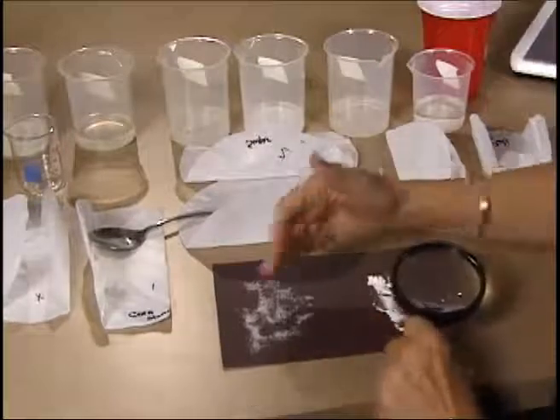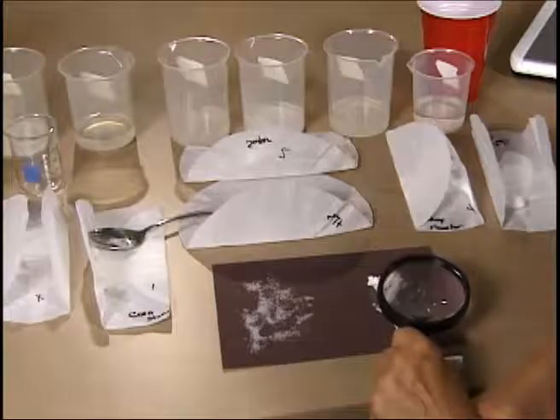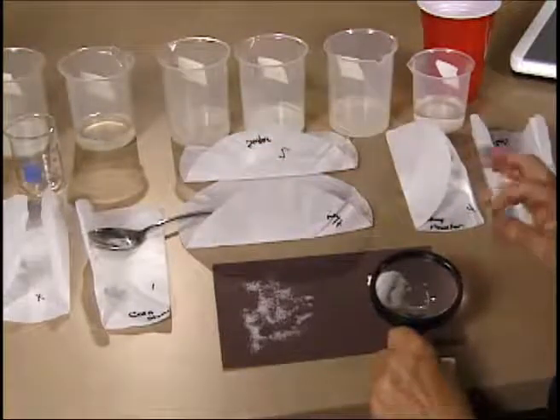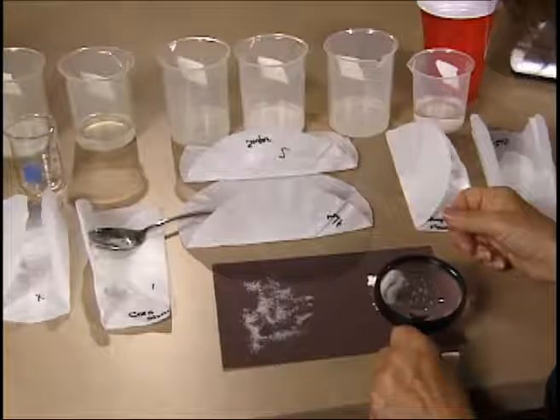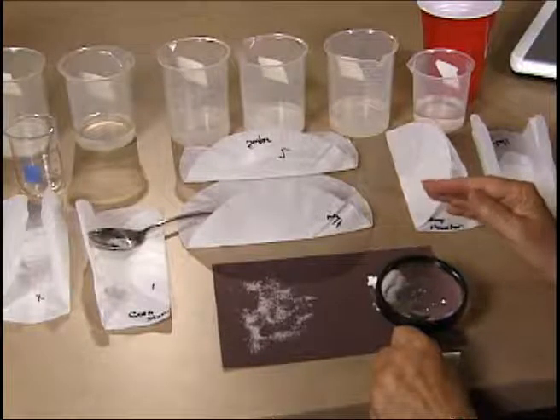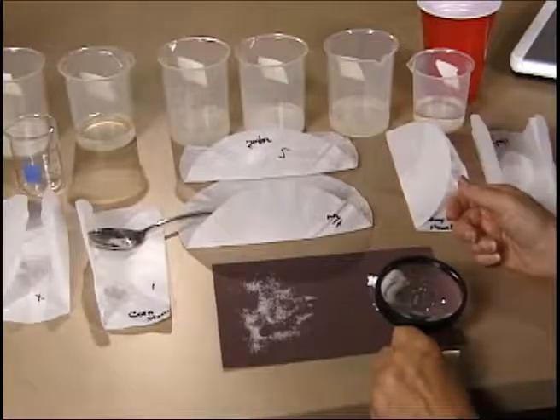And so the difference between these two substances is obviously very clear, and as we go through each of the other substances, we will see exactly the same thing, that there is a little bit of uniqueness about each of the substances, hopefully, but not so significant that I could just look at the unknown and tell which one it is.